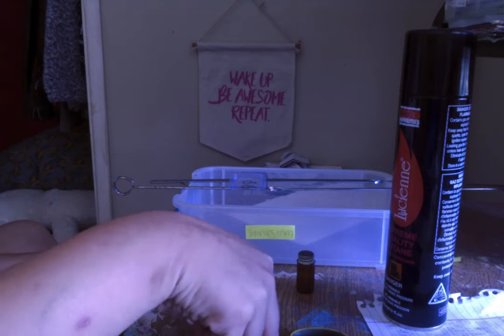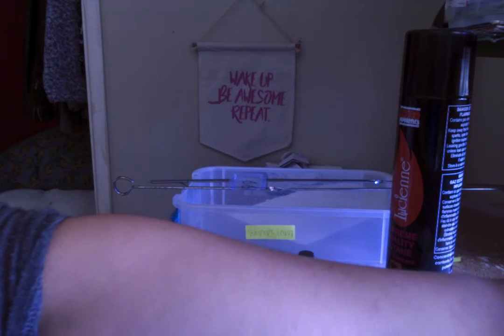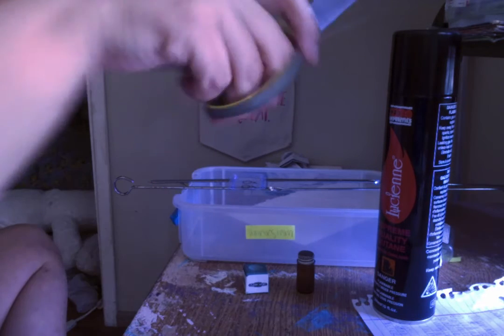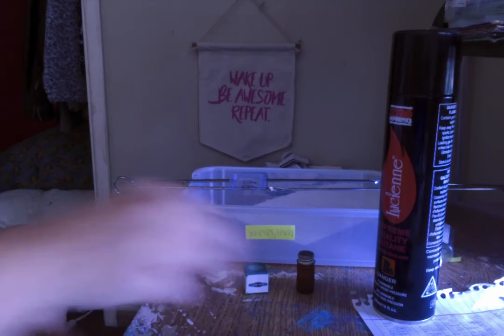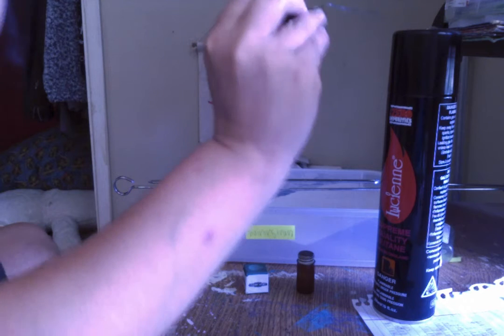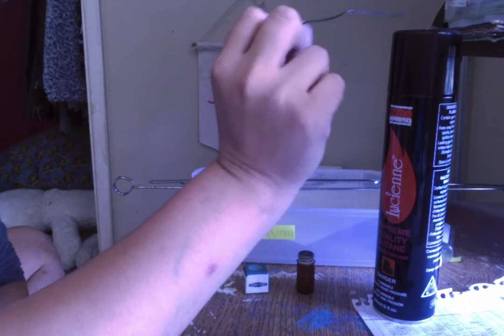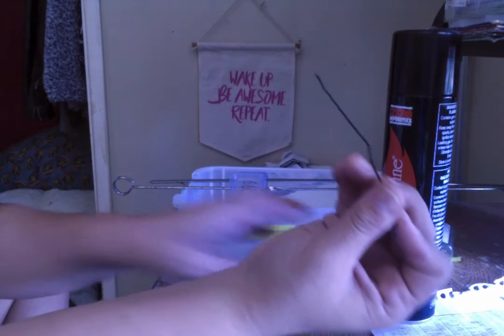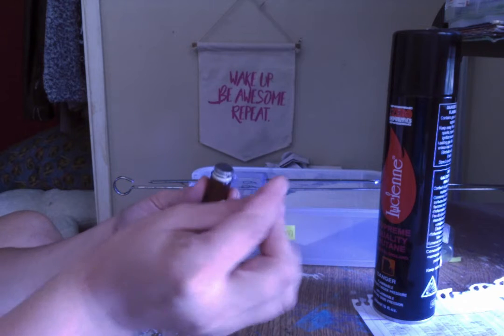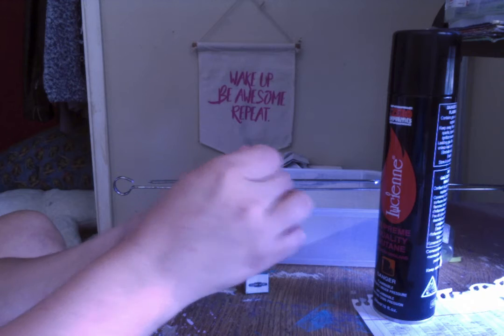We're going to light the gas, turn the gas switch on, you should hear it, grab the striker, turn on the Bunsen burner, use the inoculating loop, run it over the Bunsen burner, get it hot, red hot, flame the tip, sterilize. Then you're going to want to grab the liquid. Make sure without contaminating the loop that you can take off the lid of the liquid bacteria.